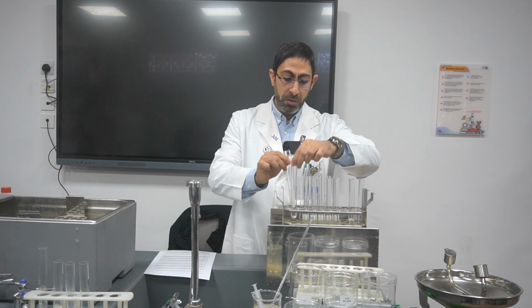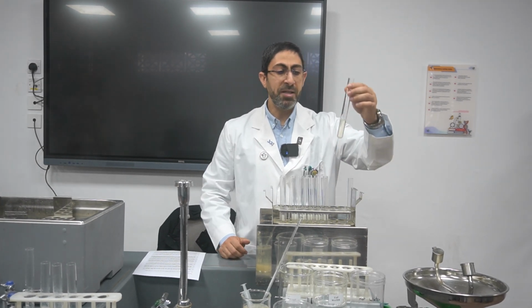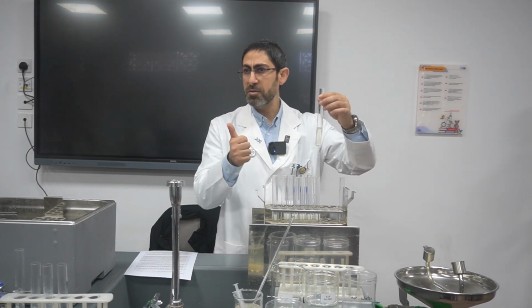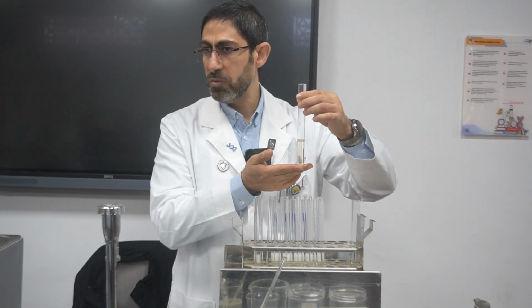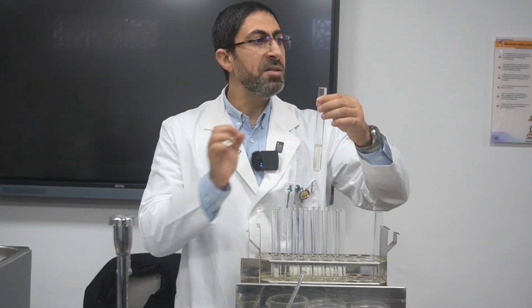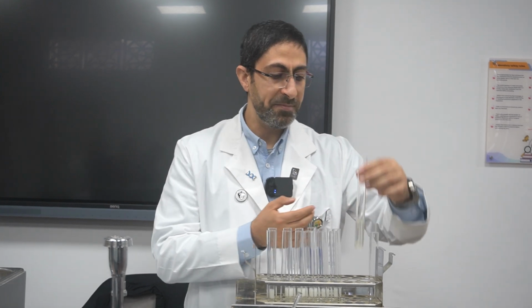For having a control, here we have 10 cm³ of the casein milk without the buffer solution and without the enzyme. It will be used as a control, for better comparison, in order to prove that the enzyme is needed to break down the protein casein.